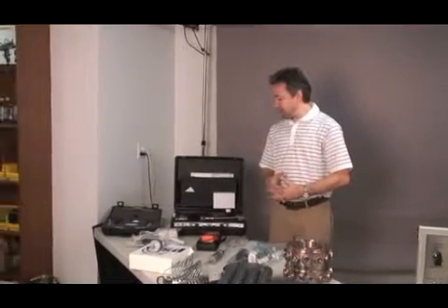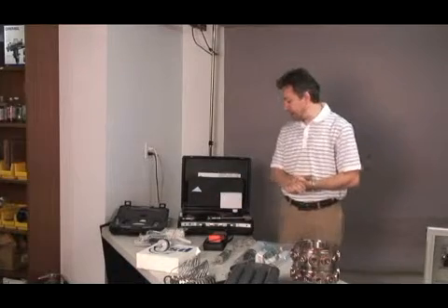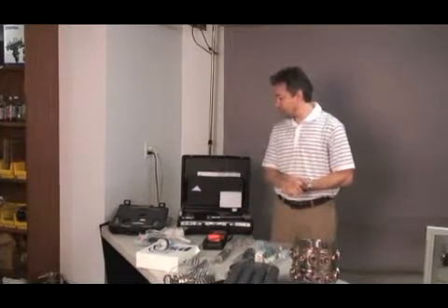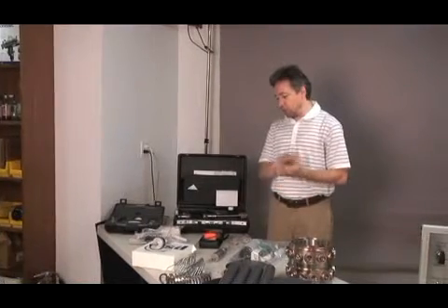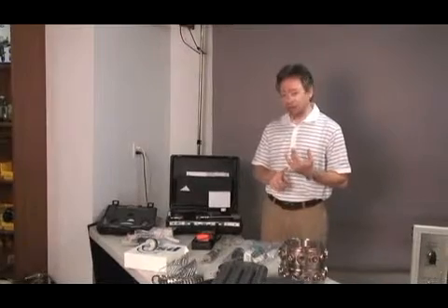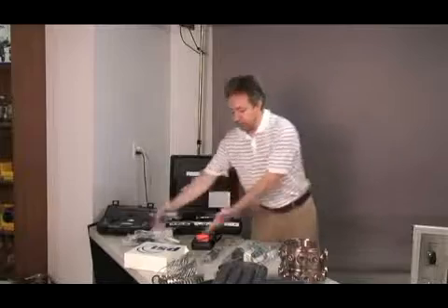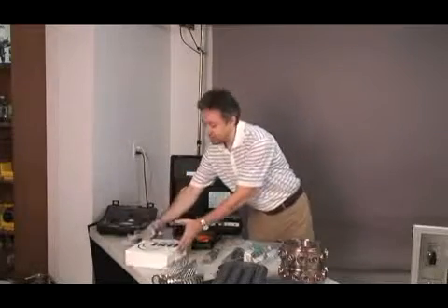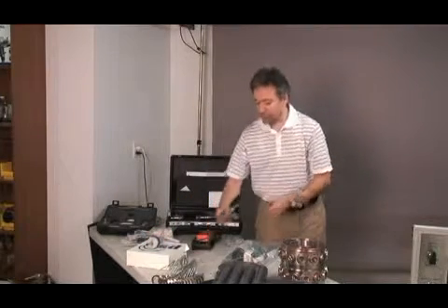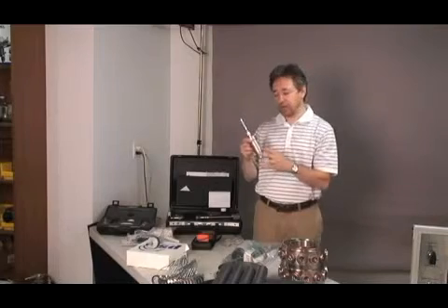We have 3 different sampling devices, actually 4, including the temperature and humidity probe that go with your system. You will be able to do gravimetric determination of concentration with a 47 millimeter filter holder and the filter pads that are in this box. Also, you will be able to do particle size distribution with a Mercer impactor, 7-stage impactor.